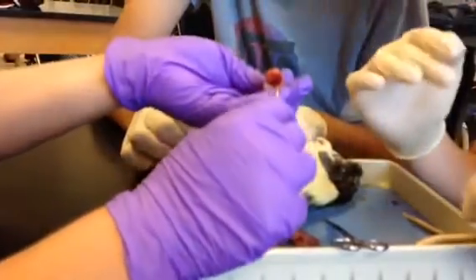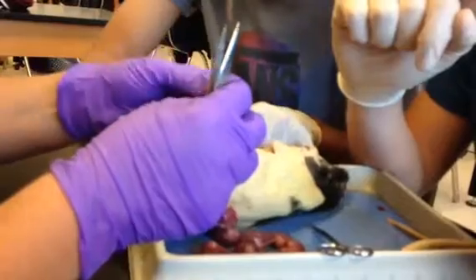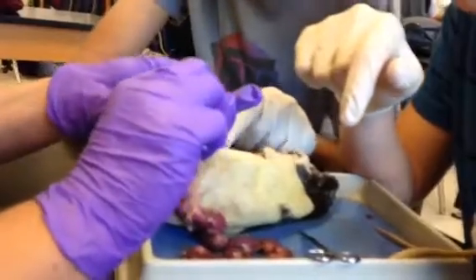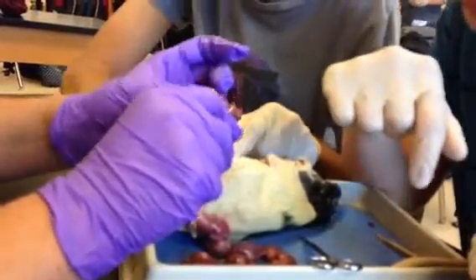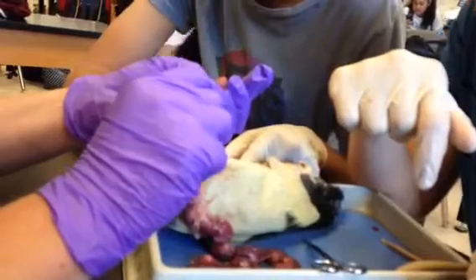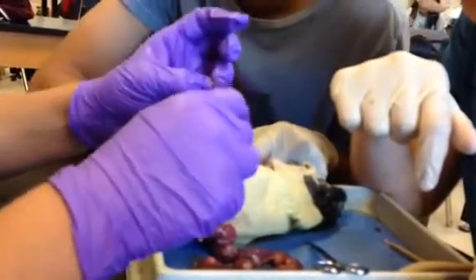Do you see what I did? I just kind of held one side and pulled the actual sack with the other. And then you've got this little lump in here. Now that little lump is part of the baby, so you have to kind of be gentle because it's all attached in there. But you just start pulling it apart, and it will have another sack on top of it. So you've got to do the same thing — just keep pulling it away, but you just don't want to cut.